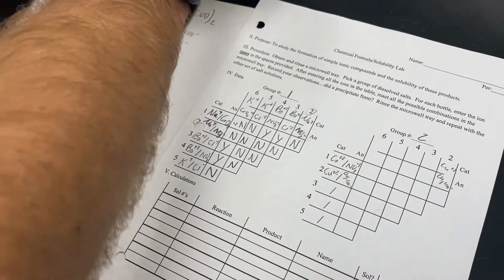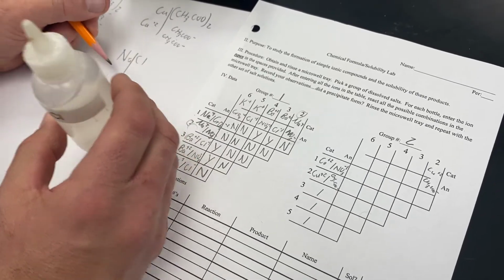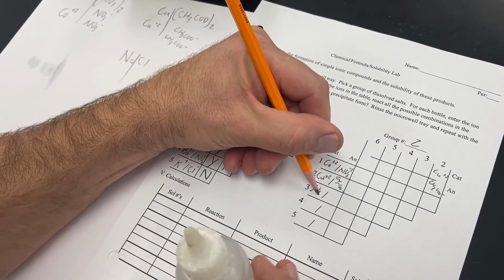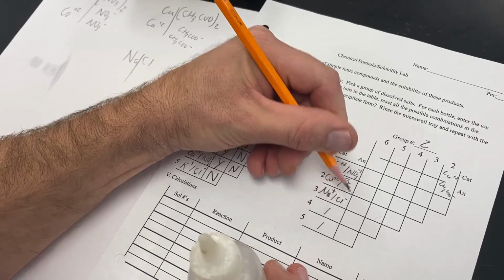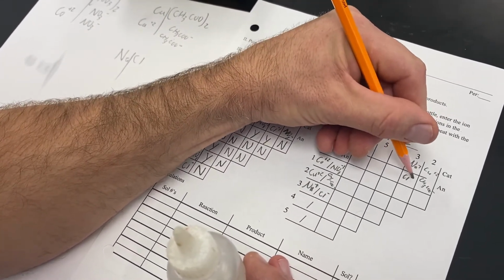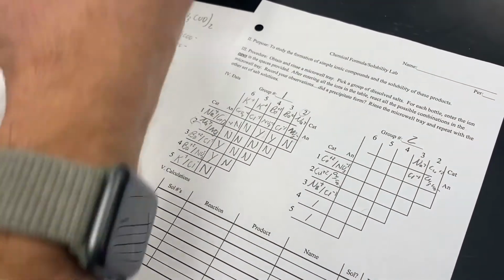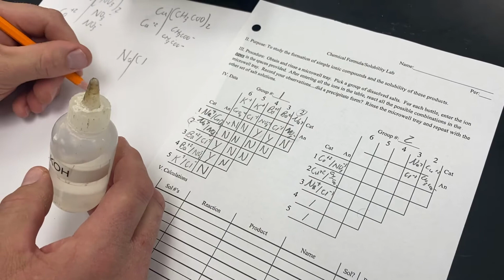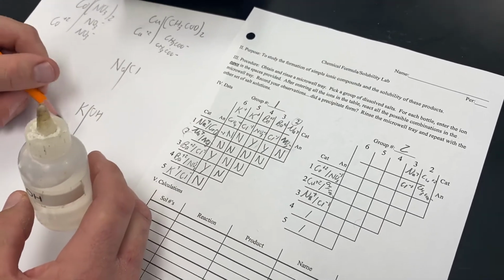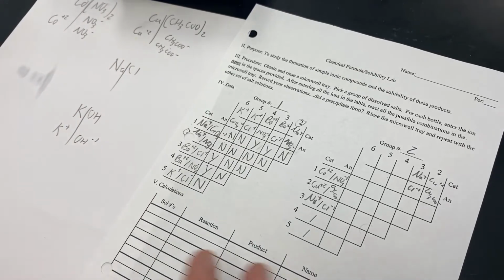Okay, so now grabbing our next bottle, our good friend table salt, break that in half, and our positive ion is sodium, and our negative ion is chloride. Writing that up here as well, we have sodium, and we have chloride. Grabbing our next bottle then, we have K and OH. These break here. Our positive ion is potassium, our negative ion is hydroxide.